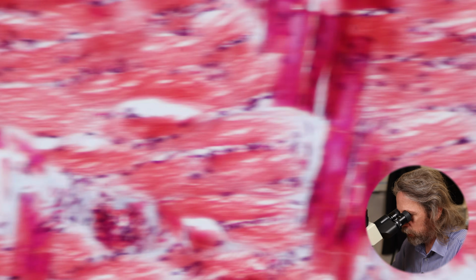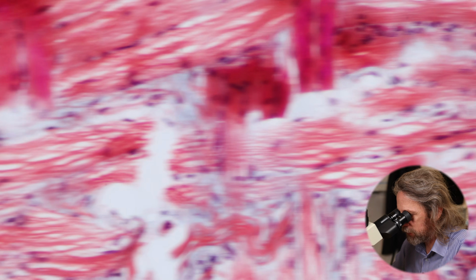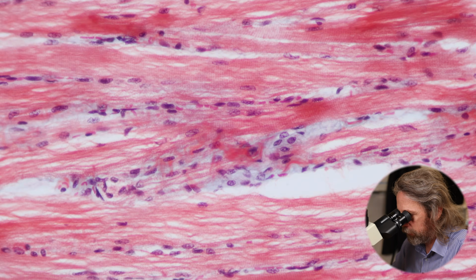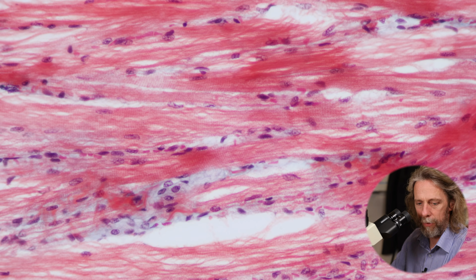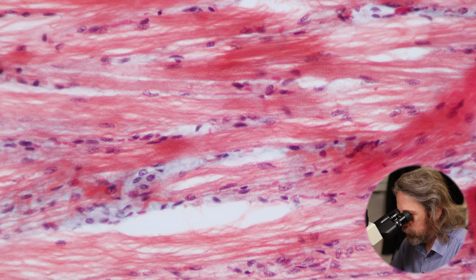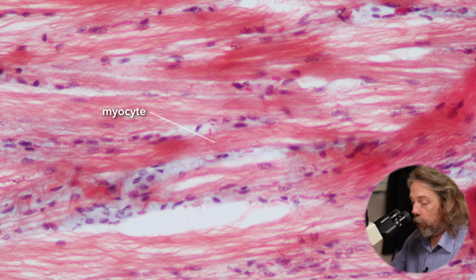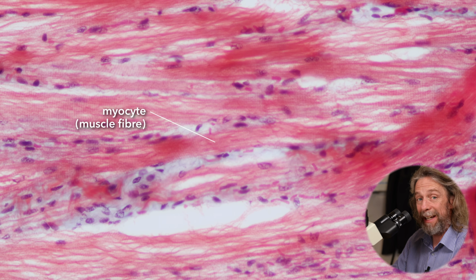So we're seeing a lot of muscle here, and of course we're seeing lots of fibrils within the muscle. Oh, that's quite good. Right. Can you see some stripes in the middle there? I have got more magnification to do, which I'll do in a minute, but can you see some stripes or imagine some stripes there?